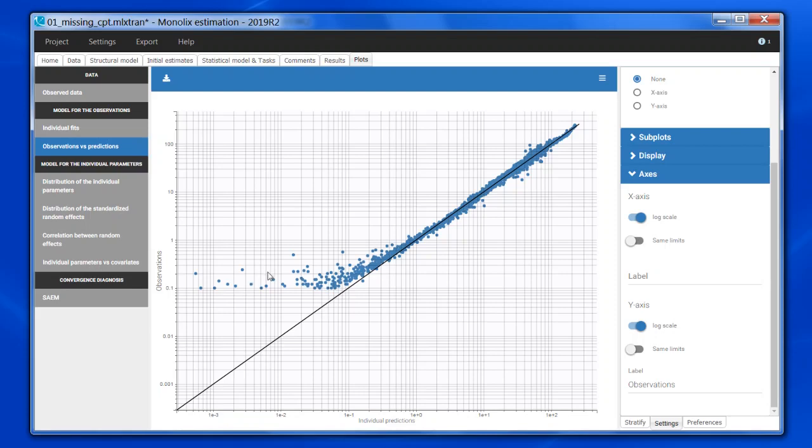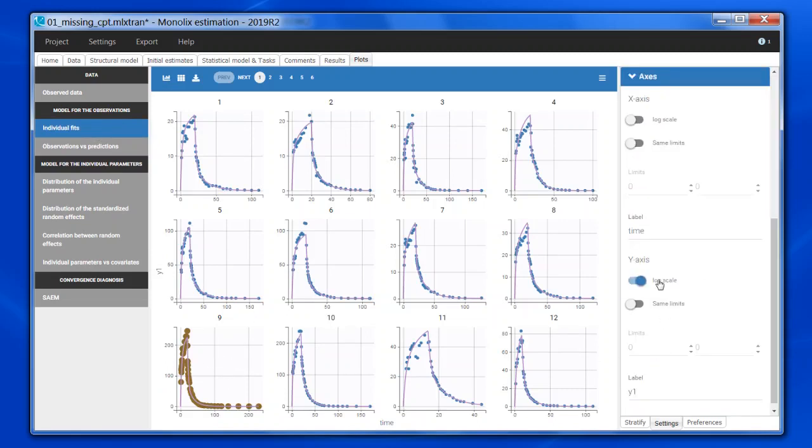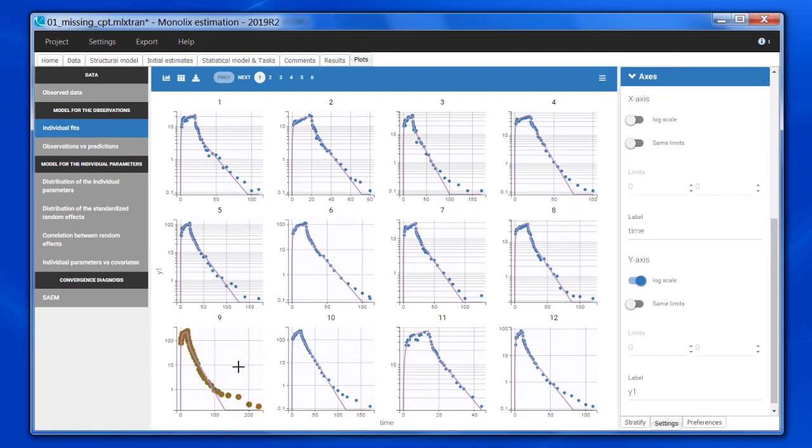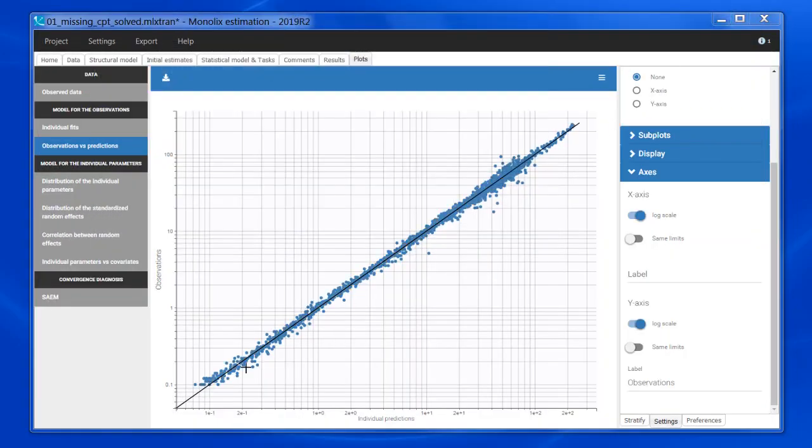Using the highlight across plots, I can focus on one individual and see it in the individual fits here. If I go again to log scale, I can see that actually there is a third slope, so three compartments are needed. So such a deviation in the Obs vs. Pred plot is typical of models with too few compartments. If I now show you the Obs vs. Pred plot after adding the third compartment, it looks like this. The deviation has completely disappeared.